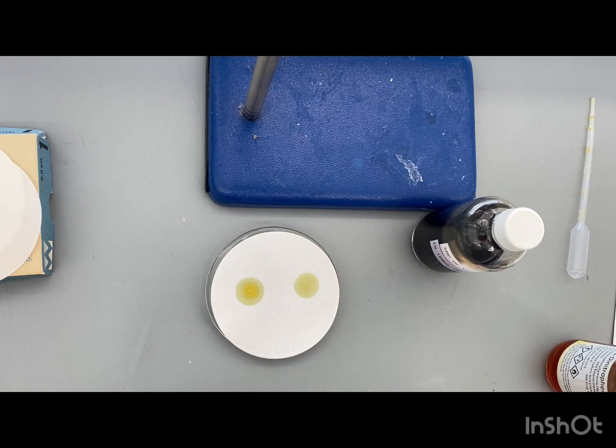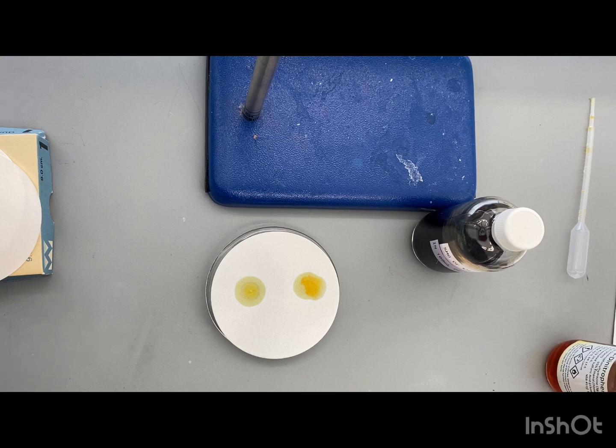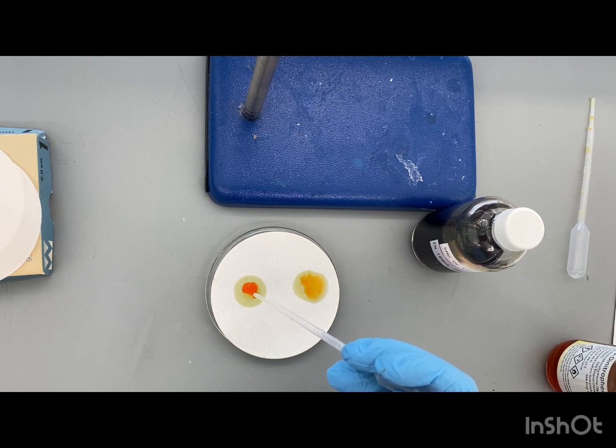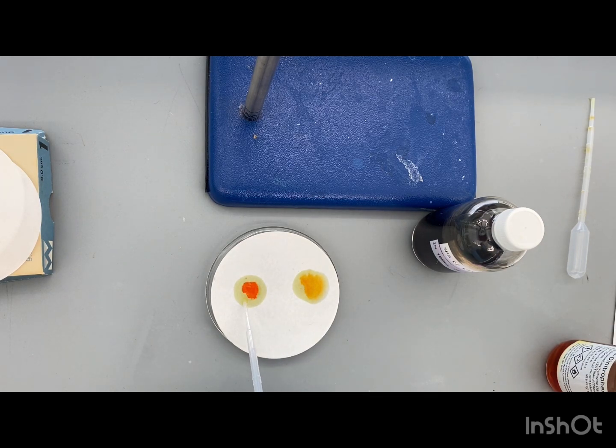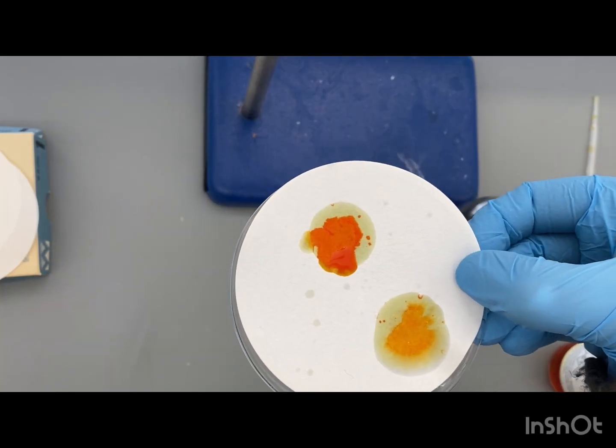This is the water for our control. As you can see, there was no color change. It still has that yellow color. And this is our product. It changed to a very bright red.